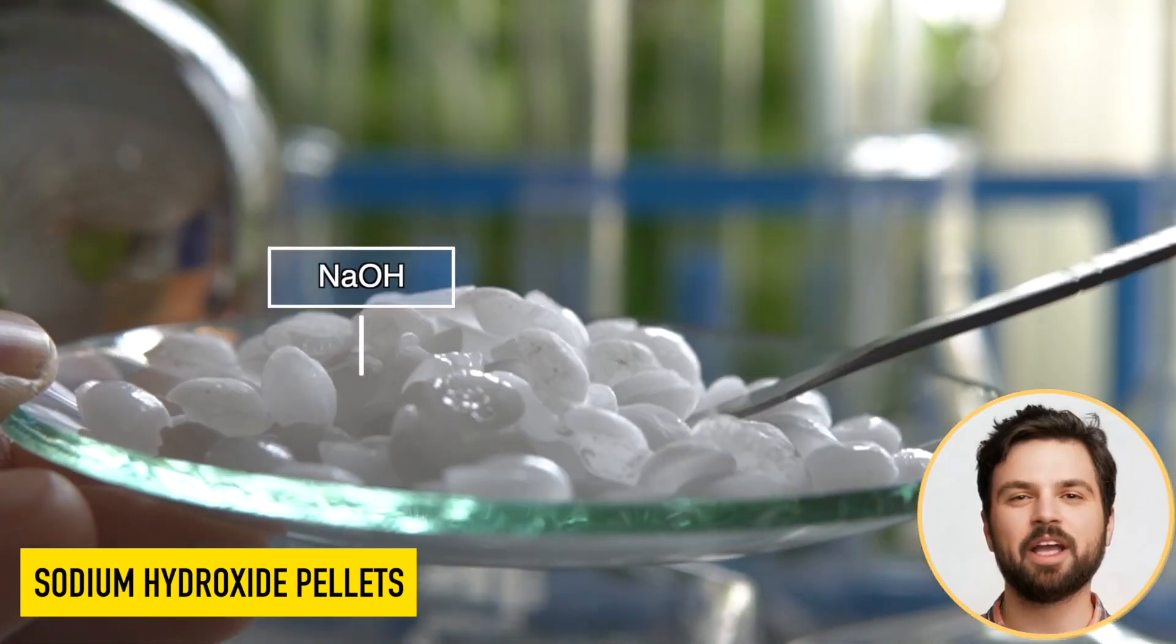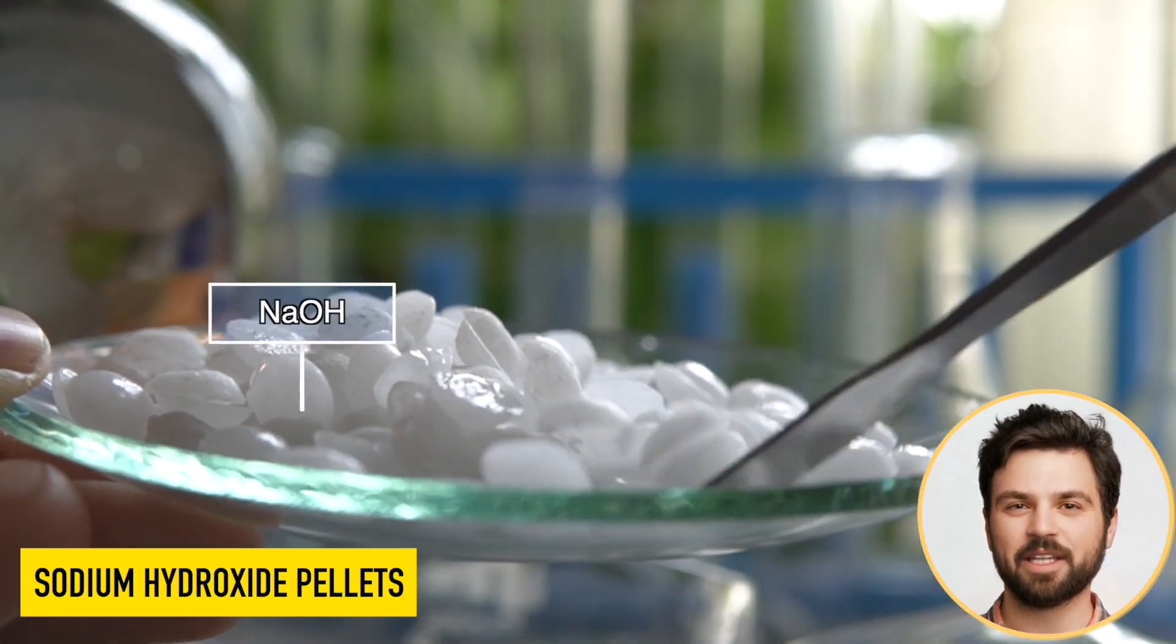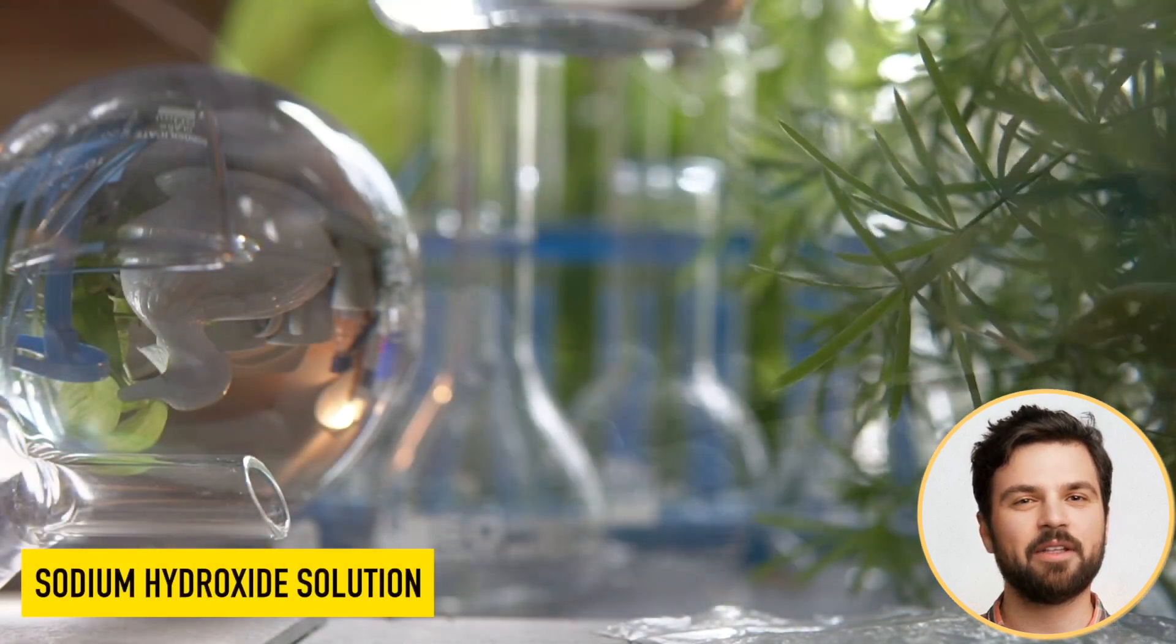These are sodium hydroxide pellets. They can easily dissolve in water to make a clear homogeneous solution.